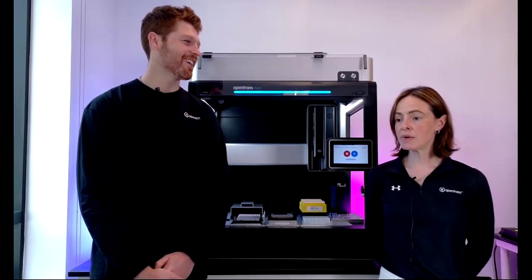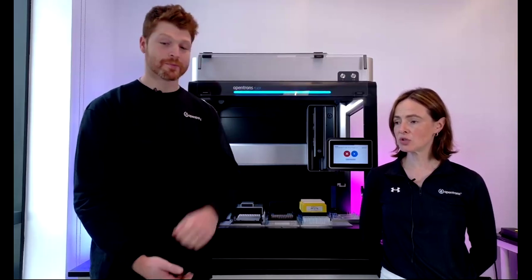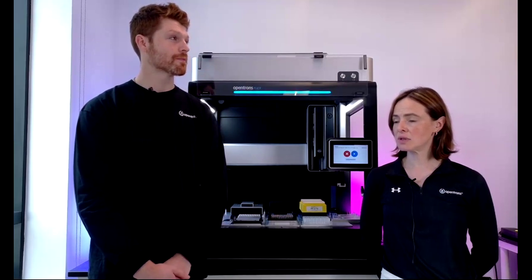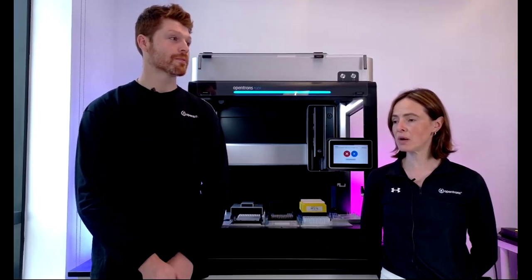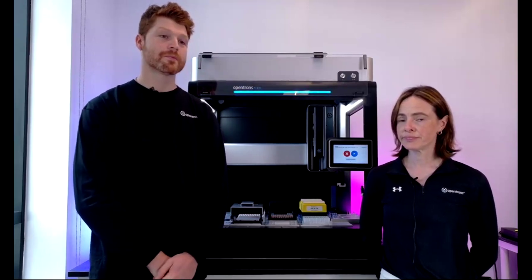As Nick said, the pipetting accuracy and the fine control of the pipetting is something we feel very confident in. I think it's just the challenge of not picking up those gel pieces, which we'd have to troubleshoot. Yeah, that definitely sounds right. I think it will depend on the bore size of the pipette relative to those gel pieces. So this user is anonymous. If you'd like to shoot us another message, we could talk offline after the call about addressing this. So I'll mark that as done.